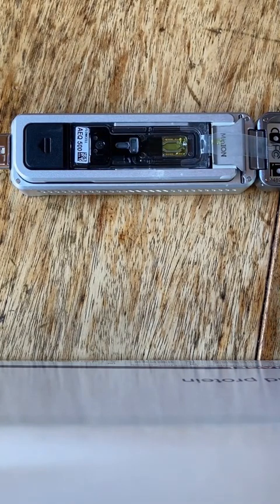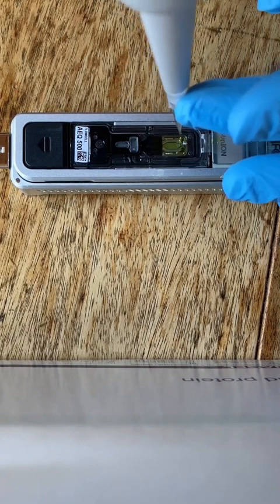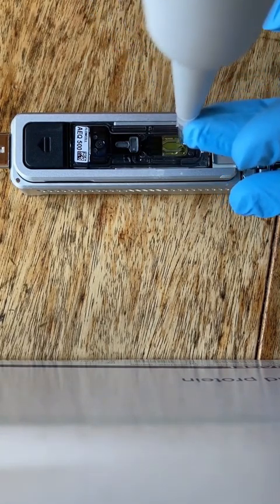You get your 120 microliters now into your P200 pipette, and you want to put that down into the pore and slowly, evenly pipette that onto or into that pore without introducing a bubble.